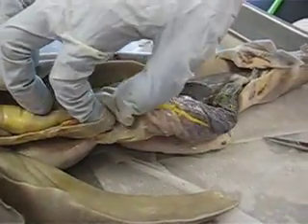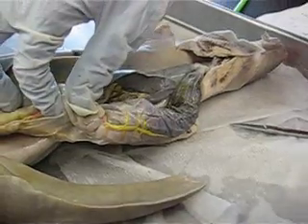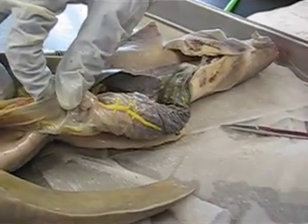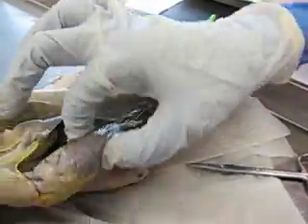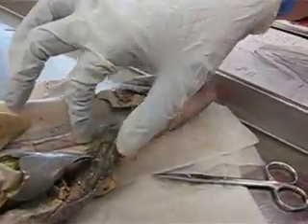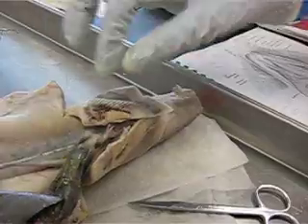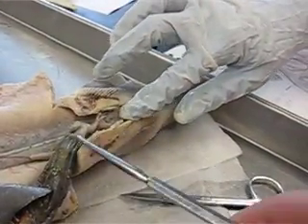The duodenum of the small intestine is going to be right near the pyloric sphincter, right in there. Here's the large intestine, this dark structure right here. And it's going to go into the colon, which is going to be about in this region right here. And then you have the rectum going into the cloaca down here.